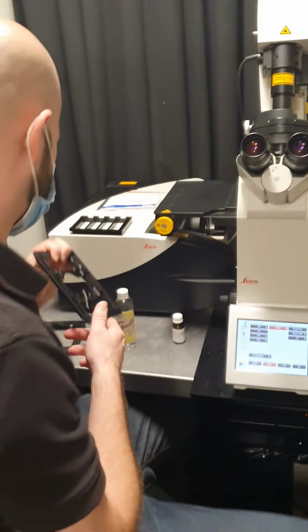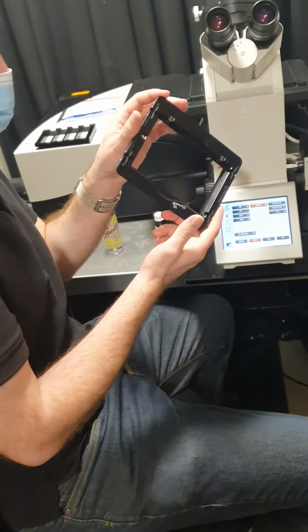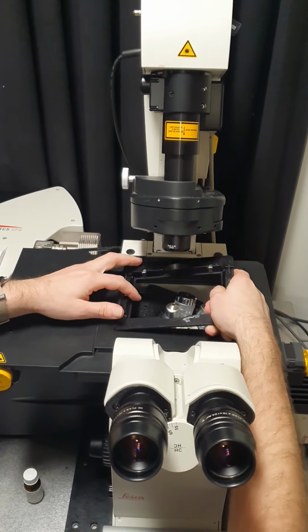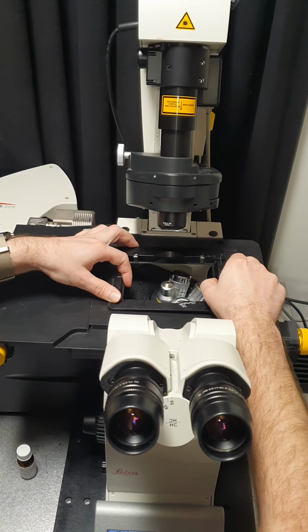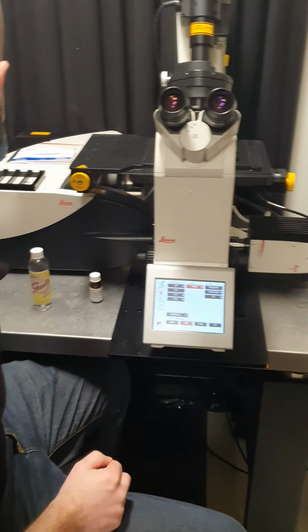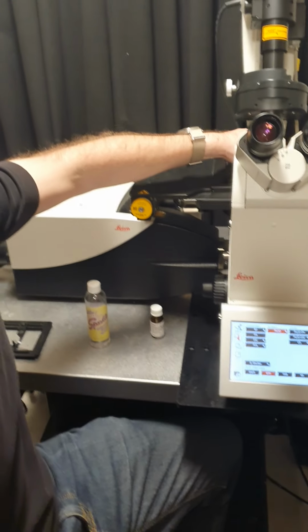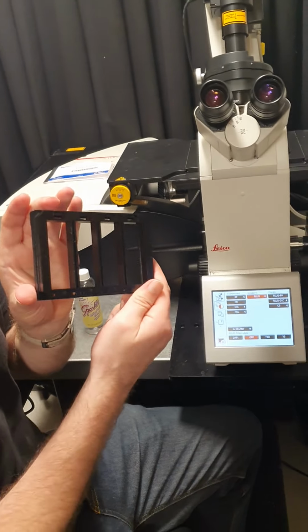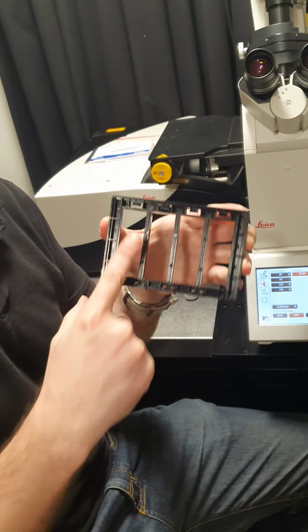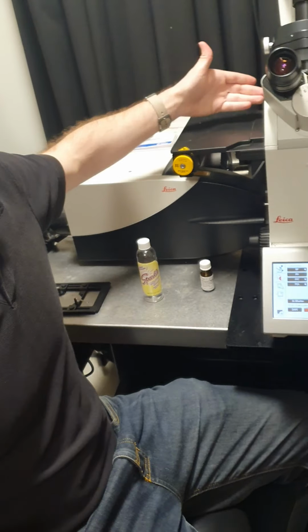right out. And then we've also got this, which holds standard multi-well tissue culture plates. And again, you just sort of push it in against the springs in the bottom left corner. And then just make sure that it's nice and solid in there, and then you can put your plate in. And then this, which is the size of a multi-well tissue culture plate and will fit in there, is actually a 4-slide holder. So you can see there's little clip springs or plastic springs, and you just clip your slides into that, and then you can have 4 slides on here at a time instead of just one.